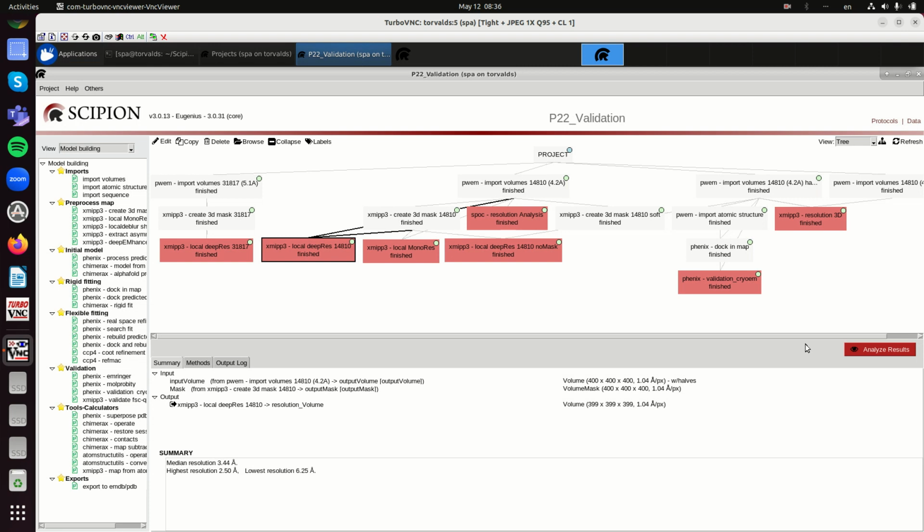We will explore different tools to analyze the validity of our reconstructed map. So the most standard descriptor of the quality in cryo-EM is the Fourier shell correlation. When the Fourier shell correlation drops below this 0.143 threshold, we report that resolution, which is in a way fine as long as we all report the same criterion, so that things can be compared.